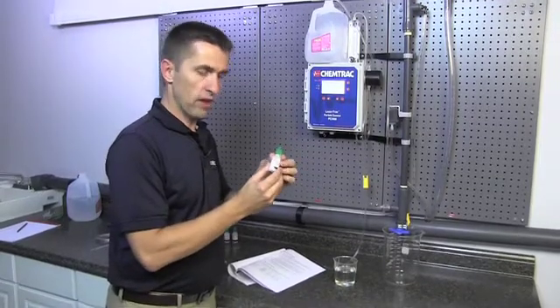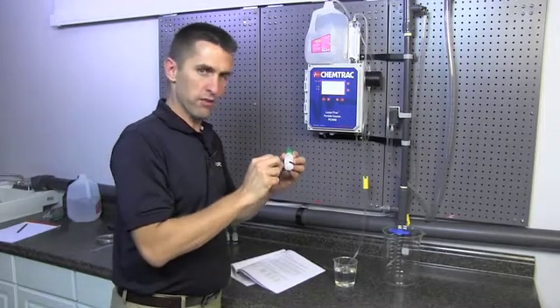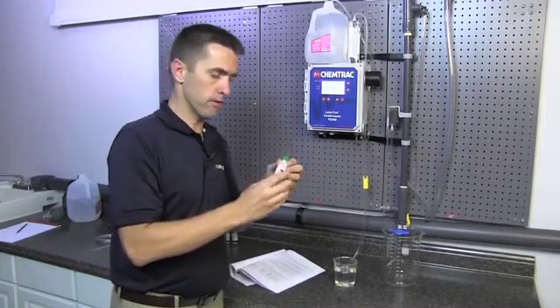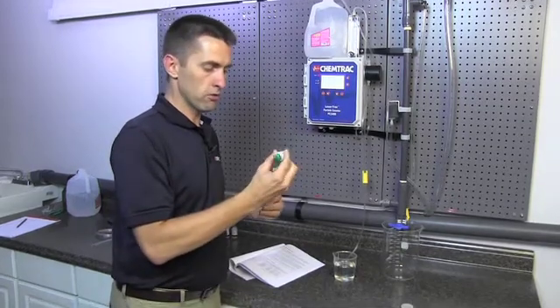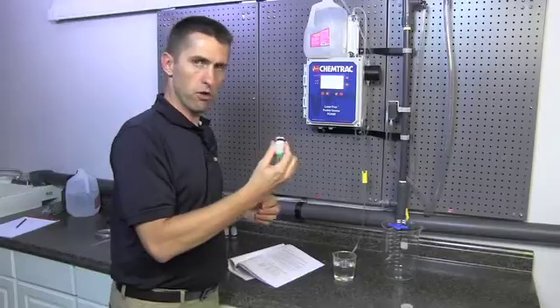What you don't want to do is take the jug and shake it vigorously. That will introduce a lot of entrained air and can possibly throw off the volume calculation. So just gently stir it for a few minutes to make sure the spheres are all dispersed.